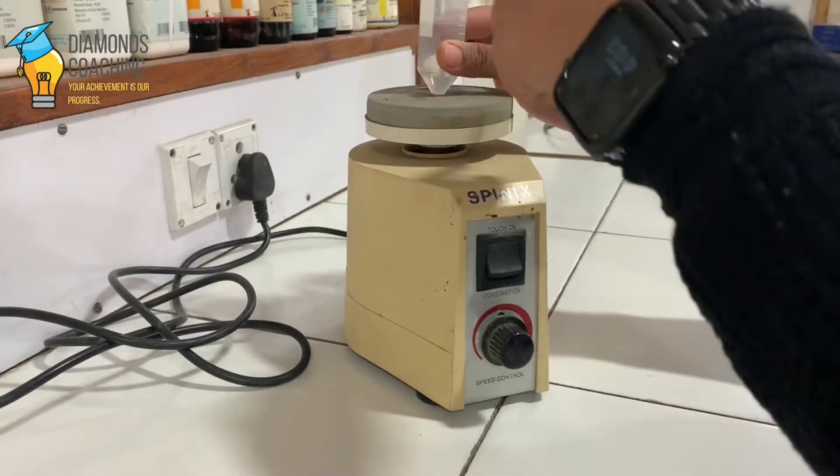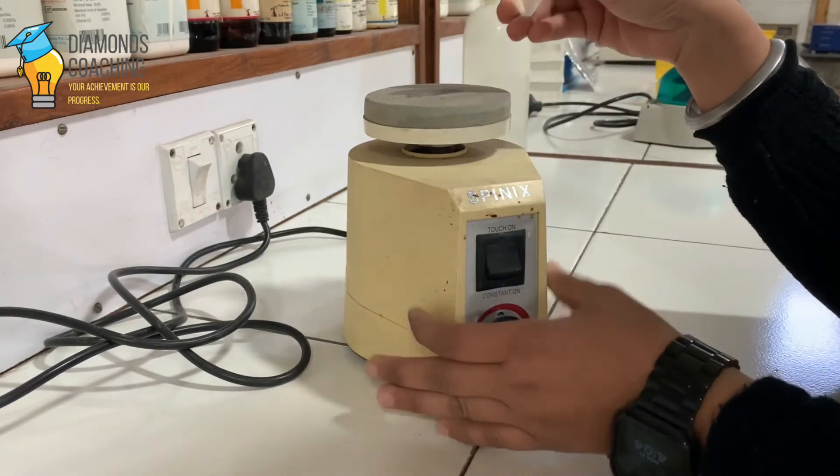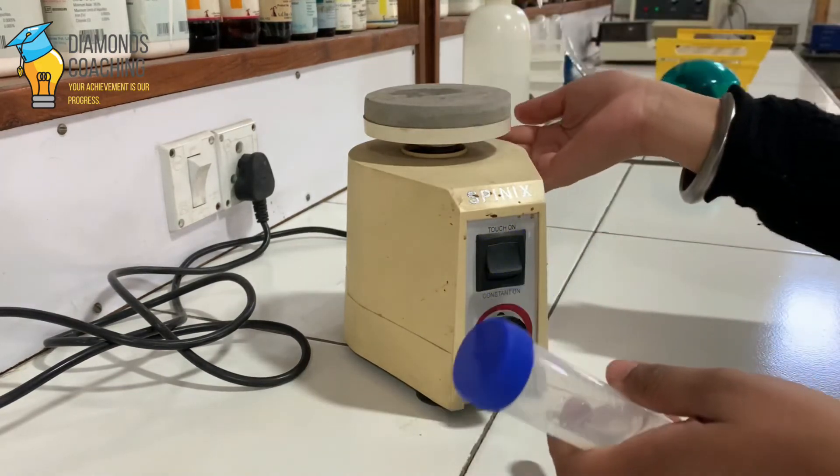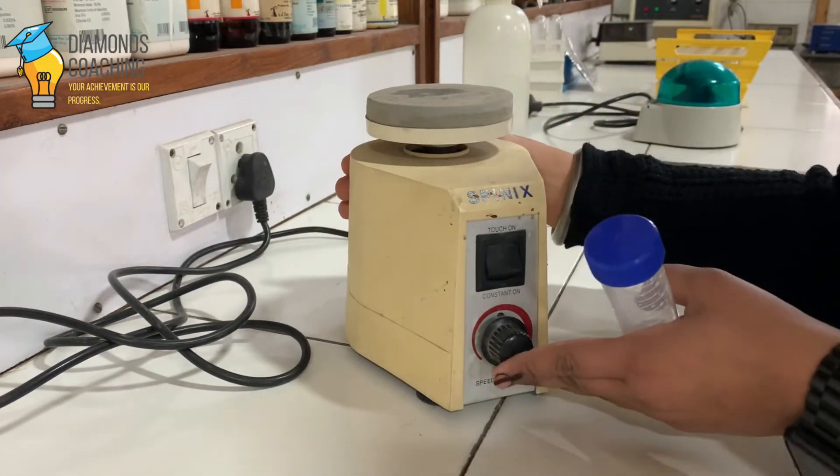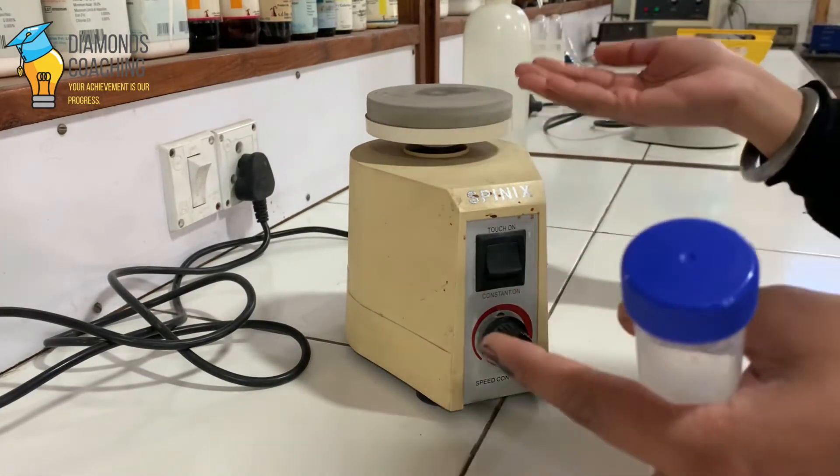So these are the ways with which we can conduct the shaking on vortex shaker or vortex mixer. So this was a little video about how the vortex shaker works and for what reasons we use this, what is the purpose of it.